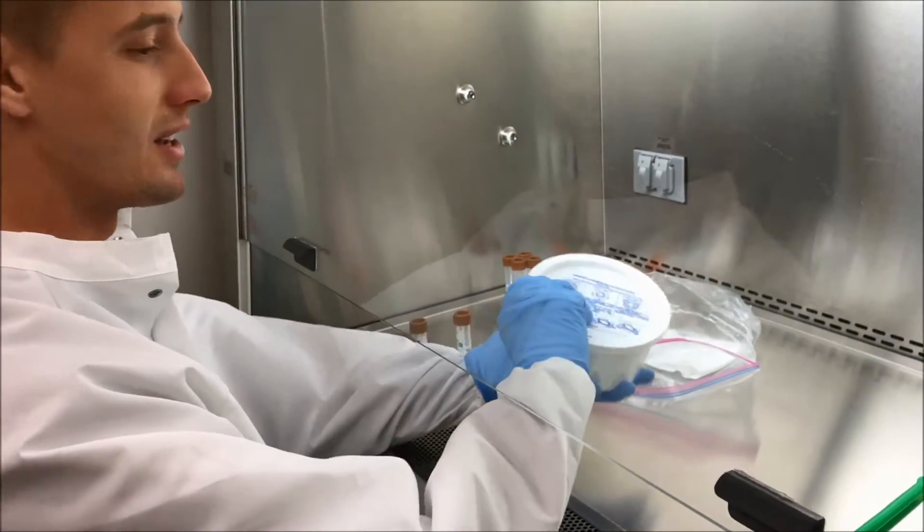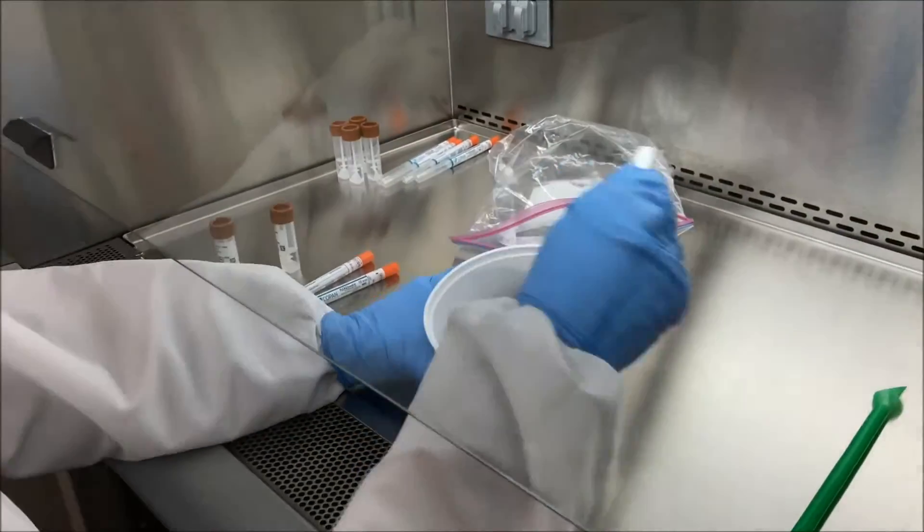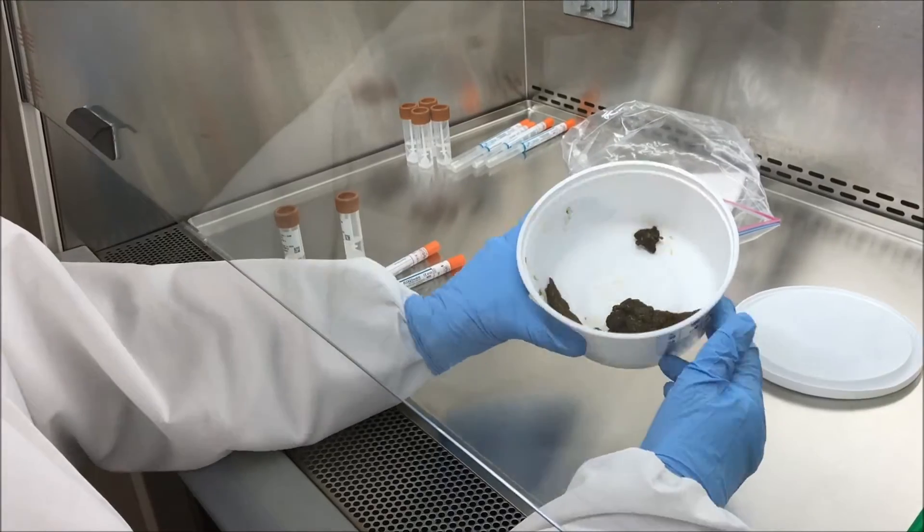So this is a surprise, let's see what it looks like. Oh, lovely. So here we have poop.